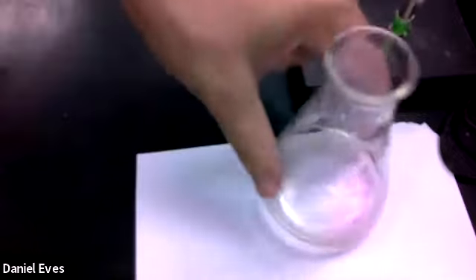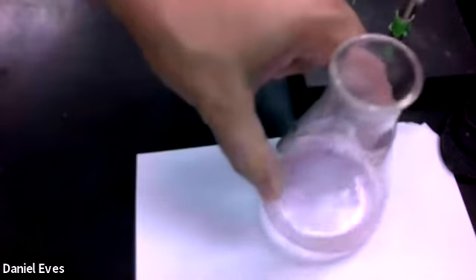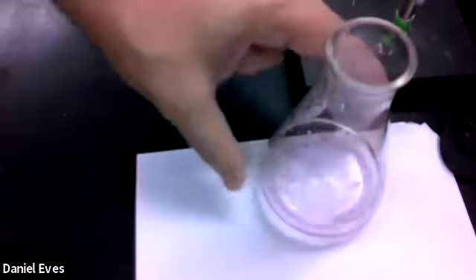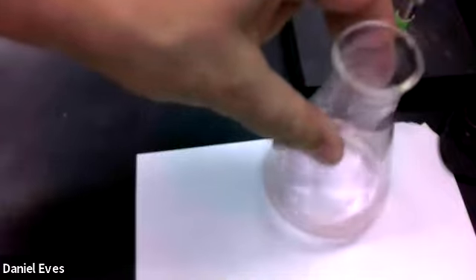Looks like we might be there. Yep, looks like it's staying. So let's watch it for just a little bit. Make sure that it doesn't turn back to the clear. It's just the palest of pinks. I hope you can see that.